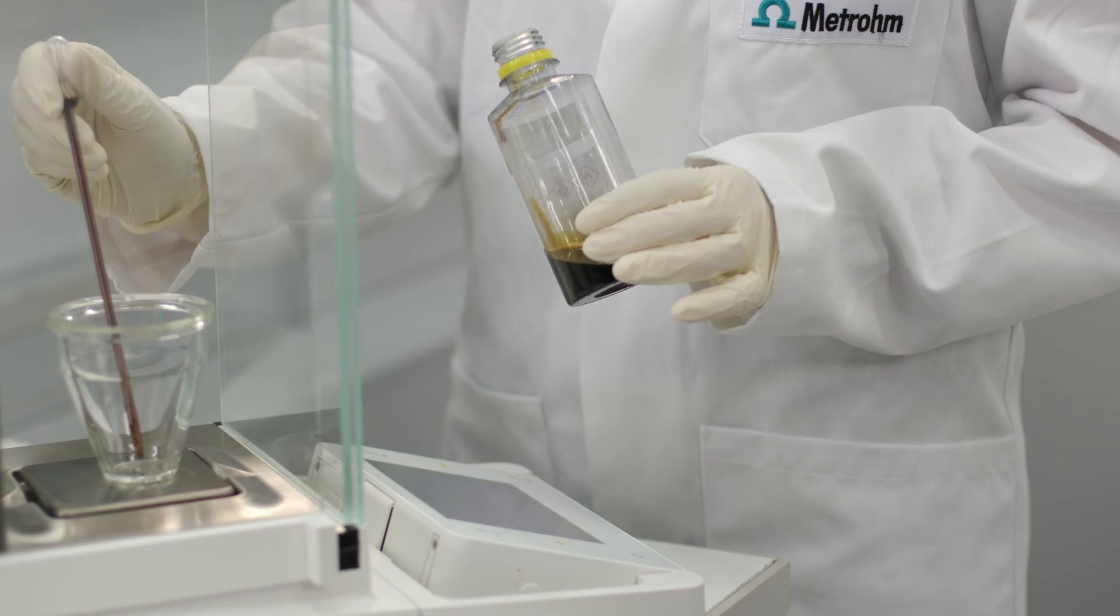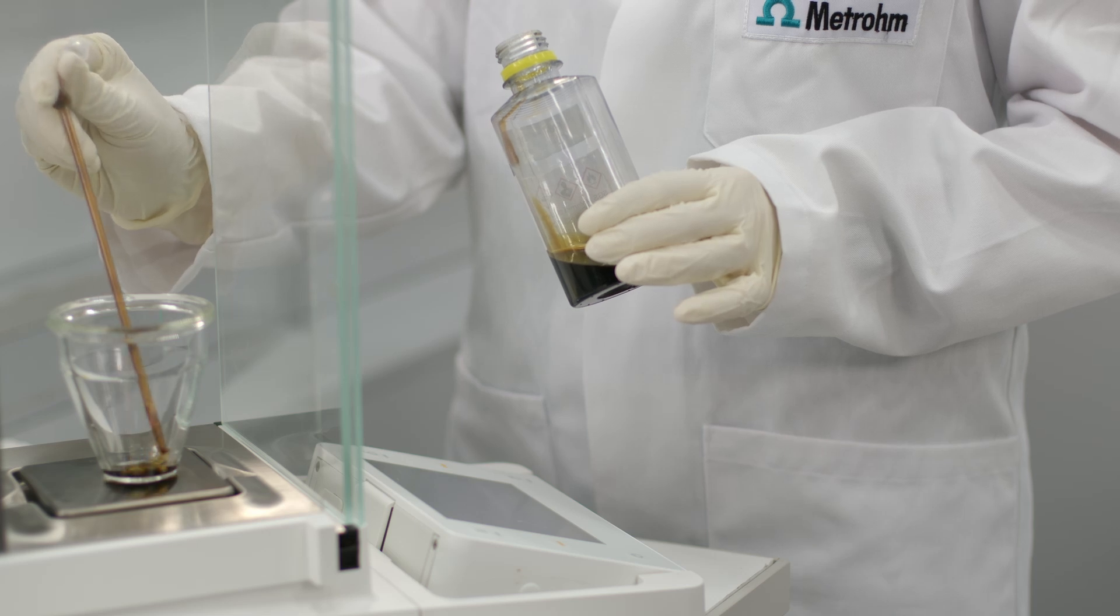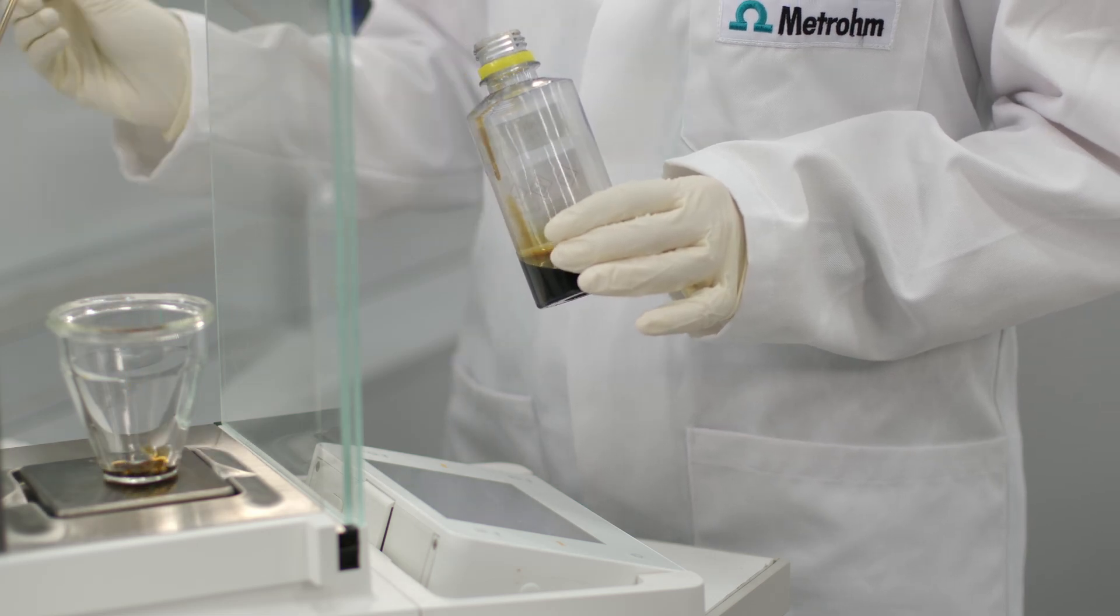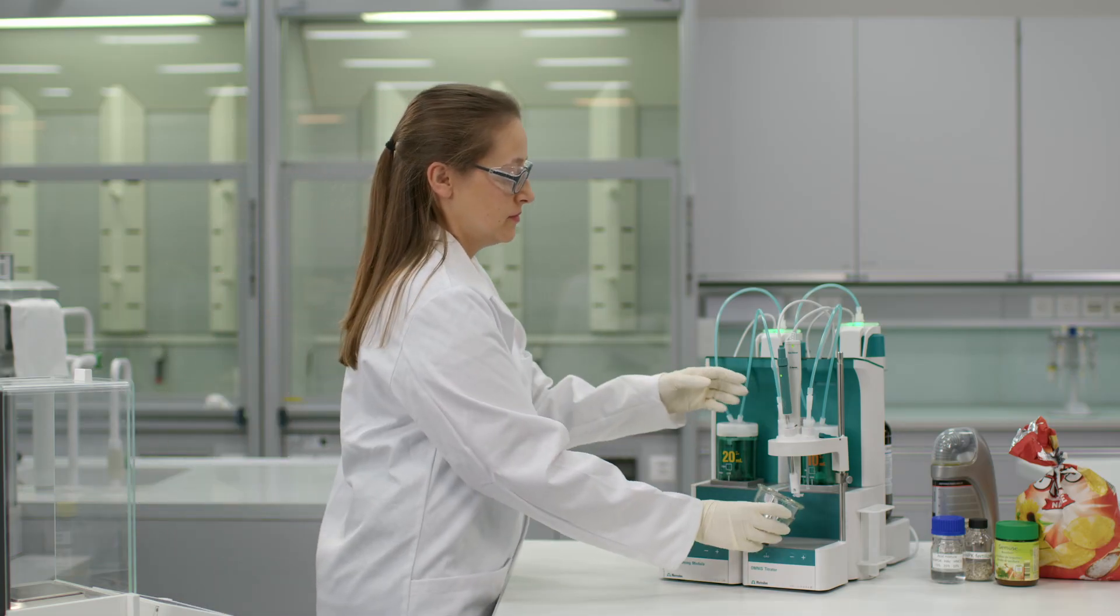Weigh in your sample and immerse the sensor into the mixture.